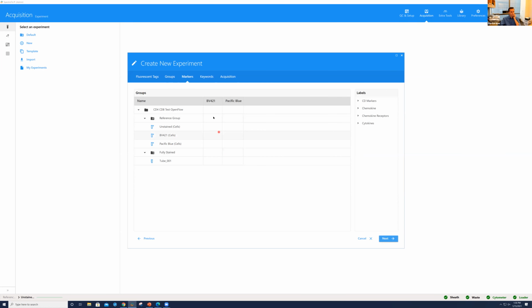And here in this area of the experimental setup, we can set labels for each fluorochrome. If I double click on the top here for the whole experiment and type in CD8, that is my BV421. It doesn't carry over to the reference group samples. I did have the option to label when I created the reference group, but I typically tend to skip that. Now here for Pacific Blue, I'm going to type in CD4 and hit enter. You do also have a list of CD markers here that you can click and drag in, should you like. I typically just tend to go ahead and label it myself.